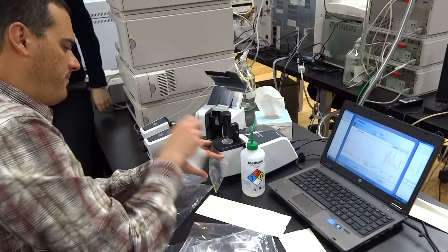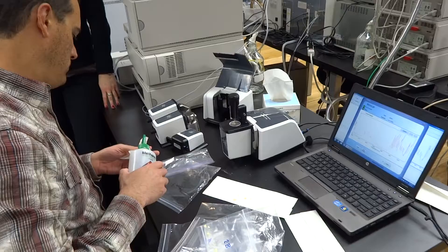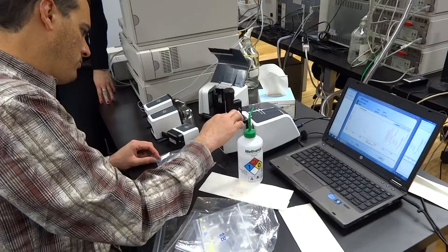Scatter noise from... And it doesn't contaminate and we have to clean off that top little push down part every time, wouldn't you? Depends what kind of sample it is. If it's some kind of sticky nasty, you probably need to rinse with alcohol.